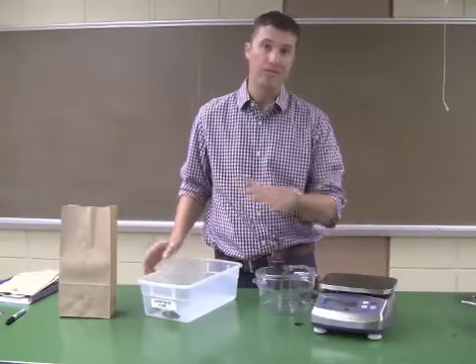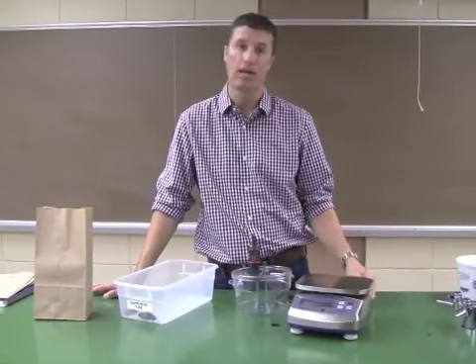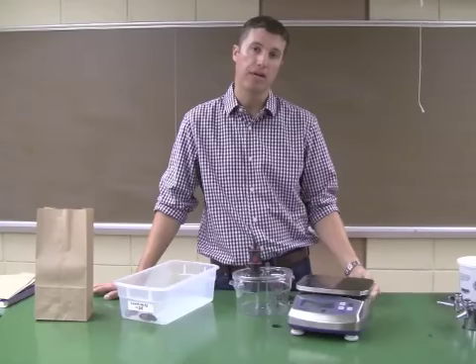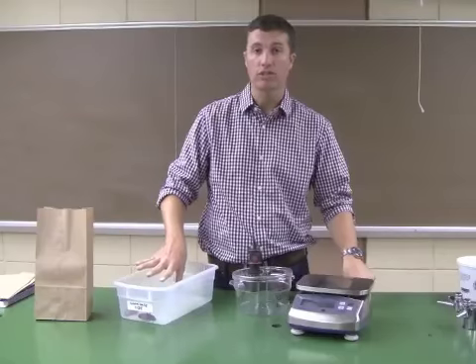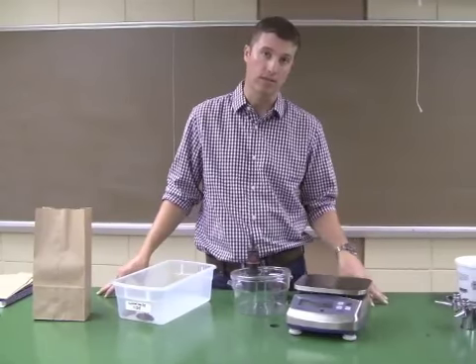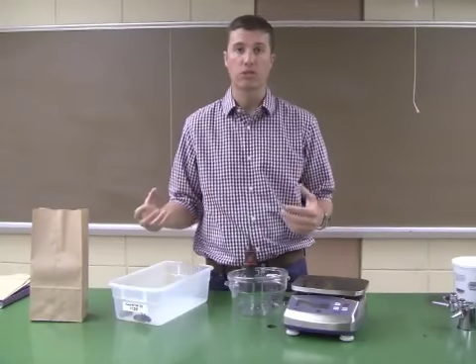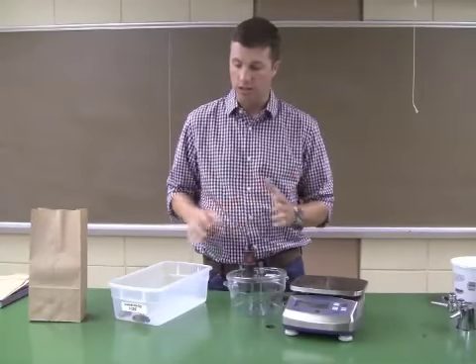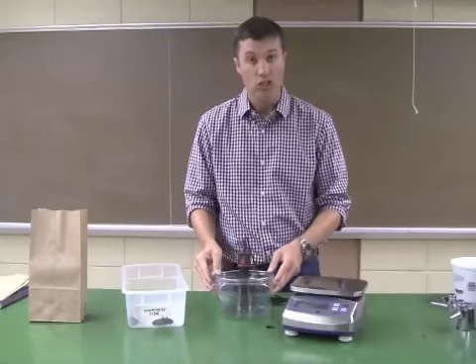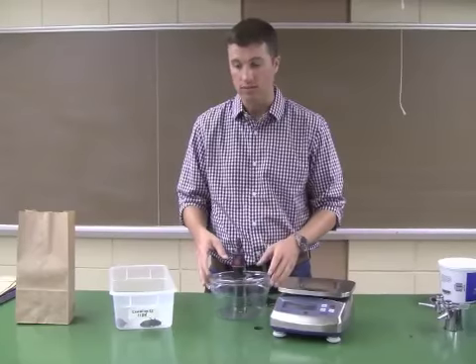All these procedures will be the same regardless of which animal you decide to test or which combinations of animals you decide to test. You should expect to have mice available, hissing cockroaches available, and possibly also crickets available to you to make comparisons between how temperature affects endotherms or ectotherms or whatever you'd like to do. We have a respiration chamber which can be heated or cooled, so you can test the effects of temperature that way.